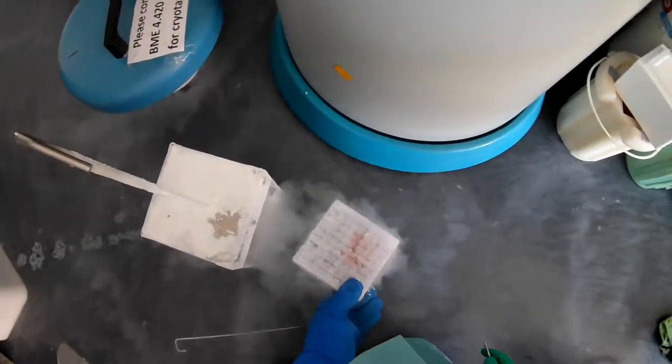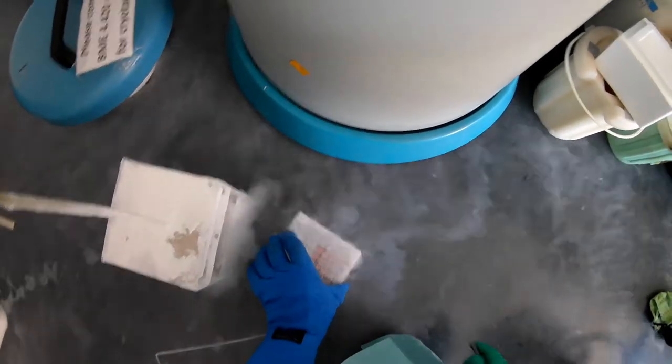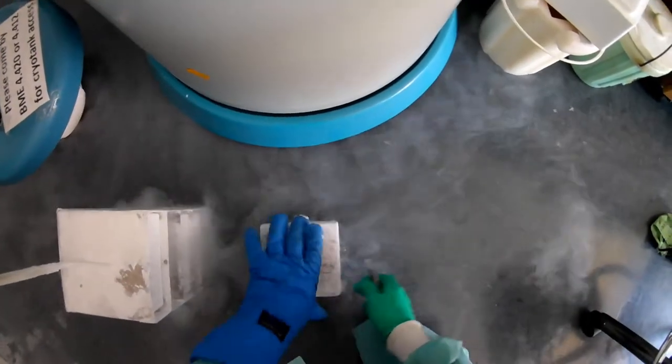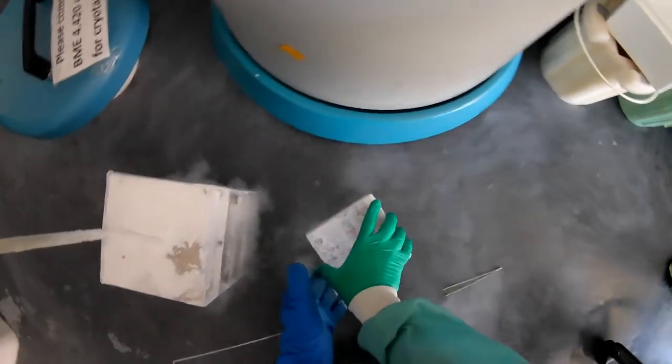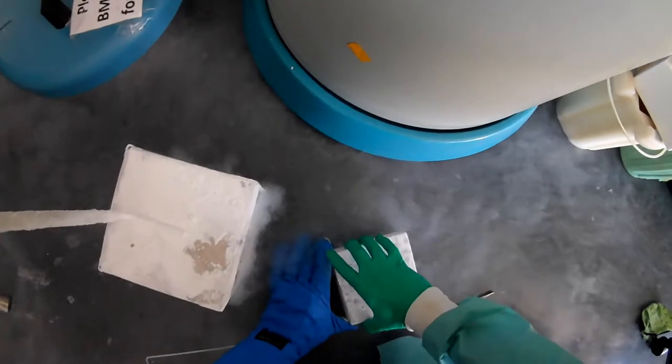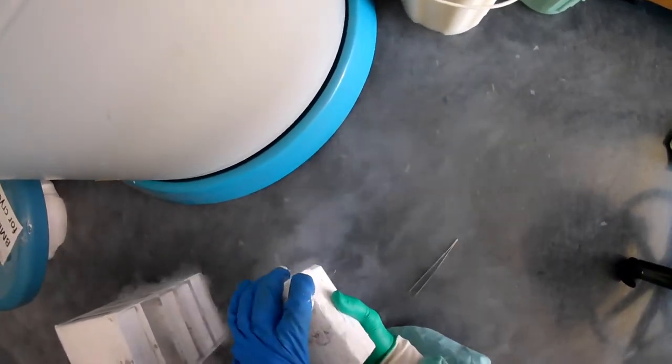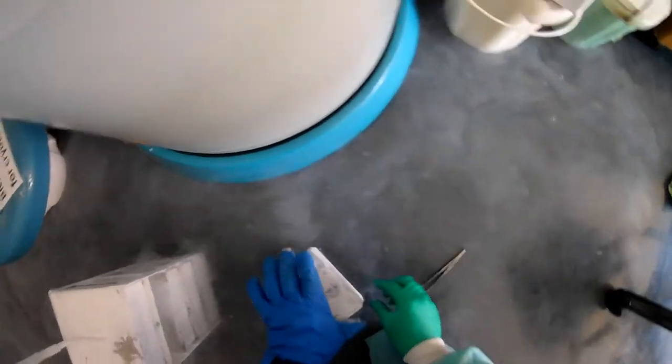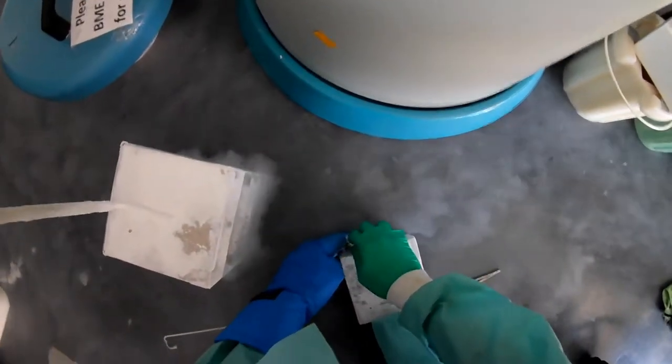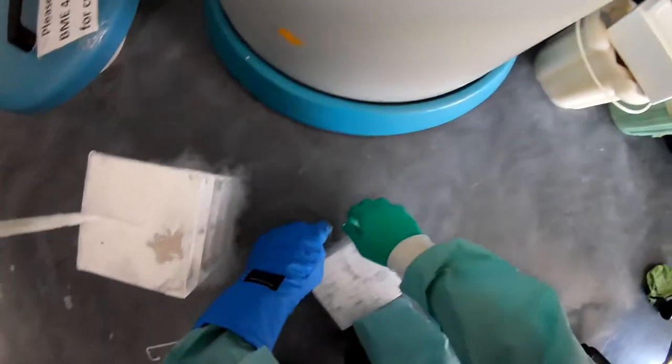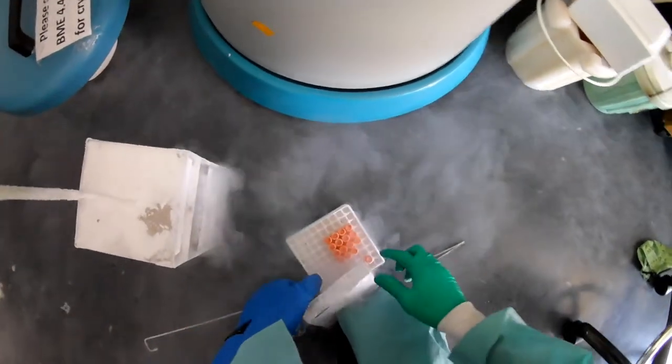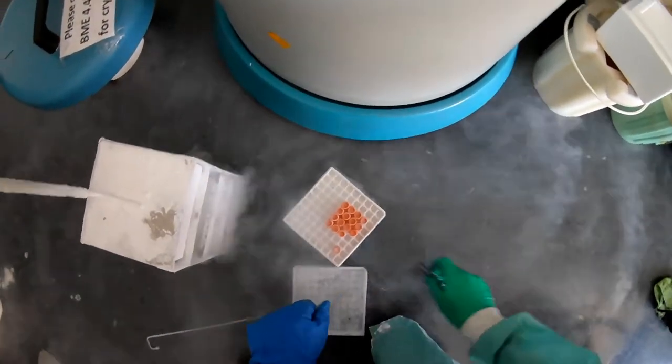And I have to be careful because there is still some liquid nitrogen floating around in here. And these boxes are cold. Here we go.